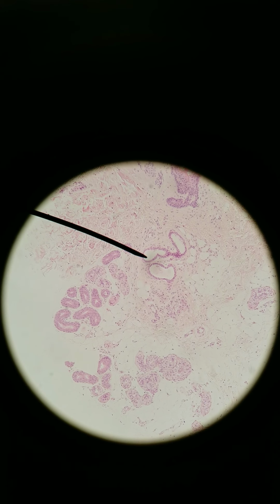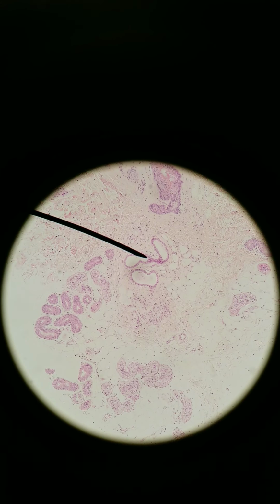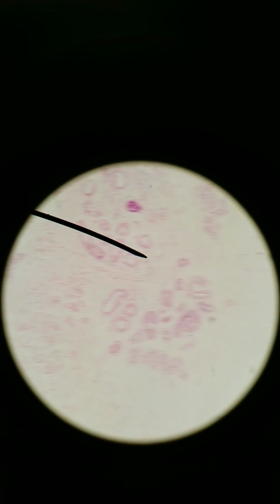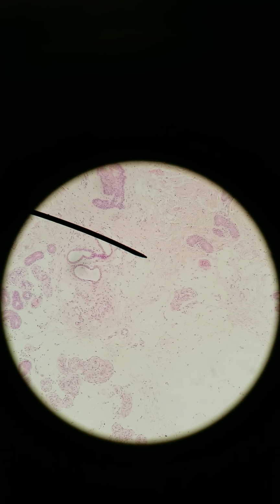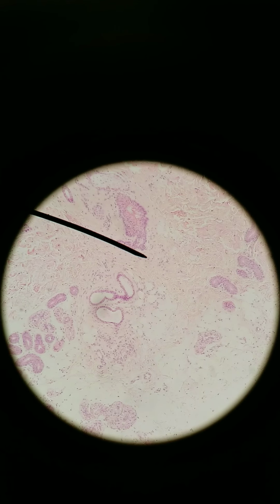But these large ones, again, 1 or 2 simple cuboidal layers, this is apocrine sudoriferous. This is the thick, smelly sweat only secreted from the armpits and the pubic region. The reason for it is not too well understood, possibly for lubrication, possibly for the release of pheromones, but it's not really shown that pheromones have much to do with our reproduction. But pheromones do play a larger role in other animals. So once again, apocrine, larger lumen; eccrine sudoriferous, smaller lumen.